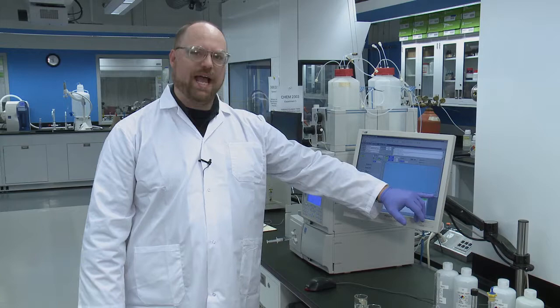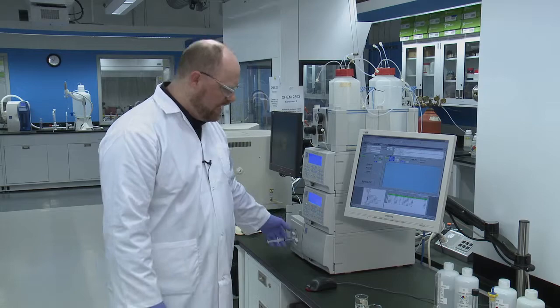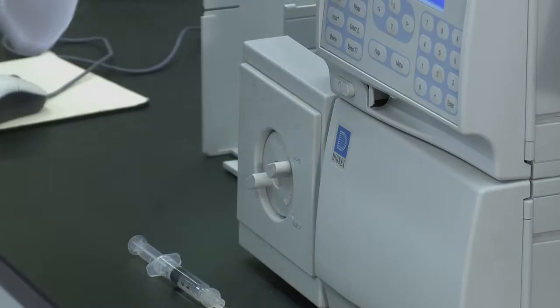You're going to turn the syringe back from the inject position to load and take out the syringe. So we're just about there. And we're at the half minute mark so we can turn it back and take it out.